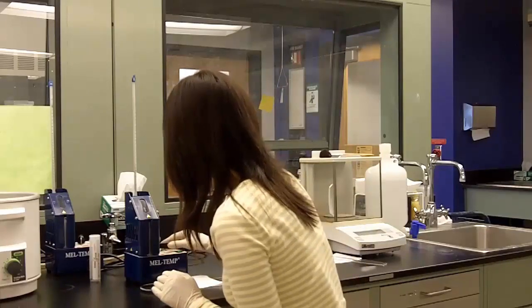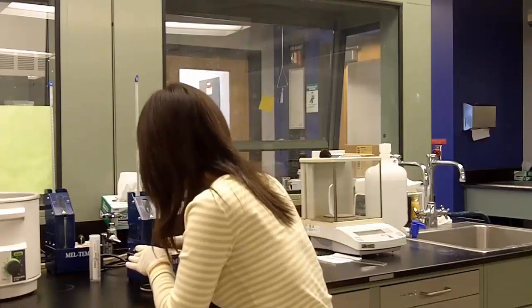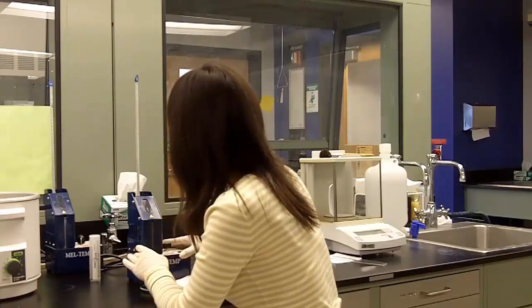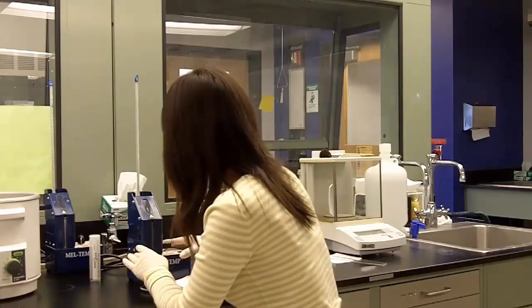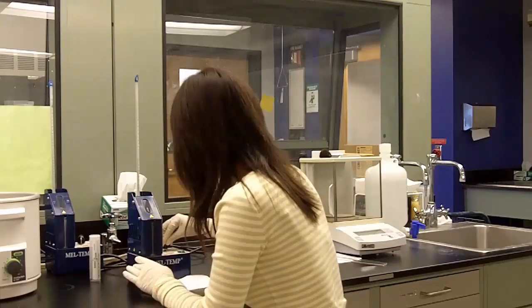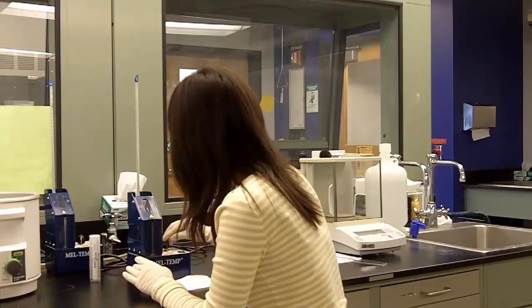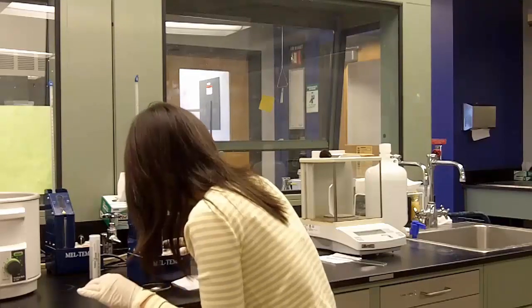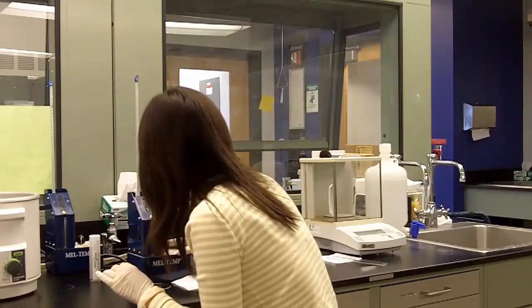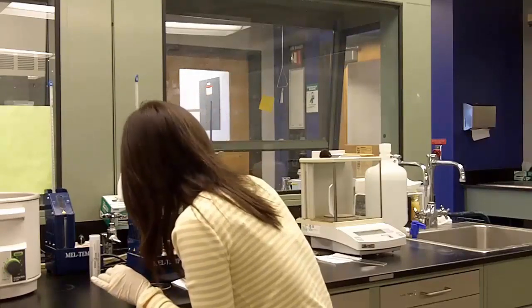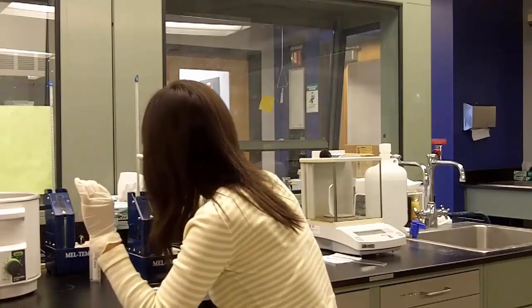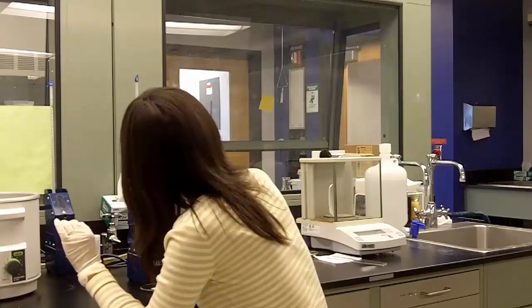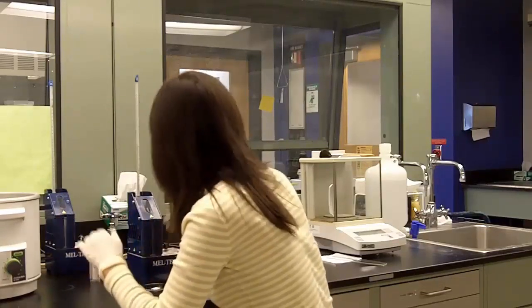Turn the power up. And where is the temperature going? Now this is the starting point, 120.8 degrees, and ending point 122.5 degrees.